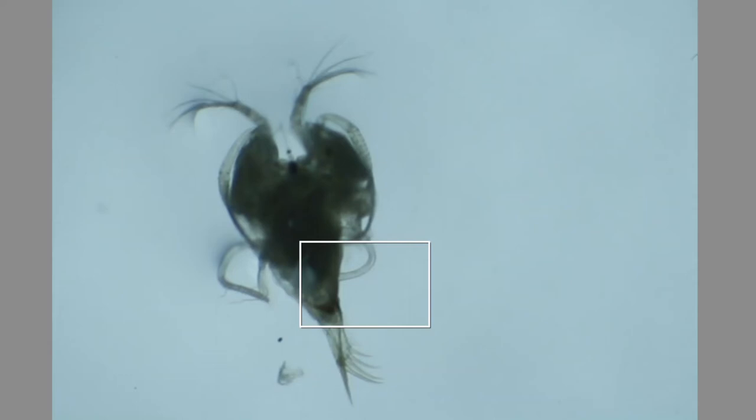In this video, I'm going to show you how to do a basic dissection of an ostracod. This ostracod has already gotten its valves removed and it's been through the ethanol rehydration series and then placed into 70% glycerol.